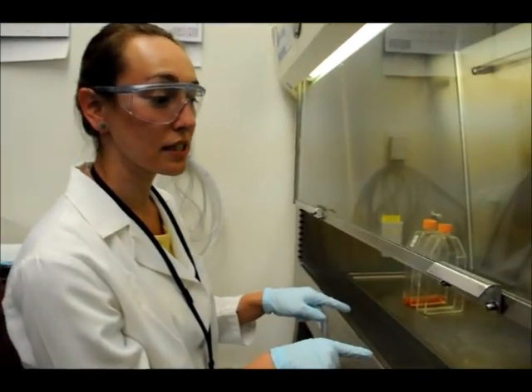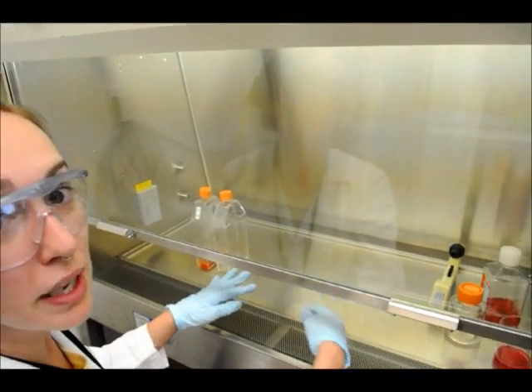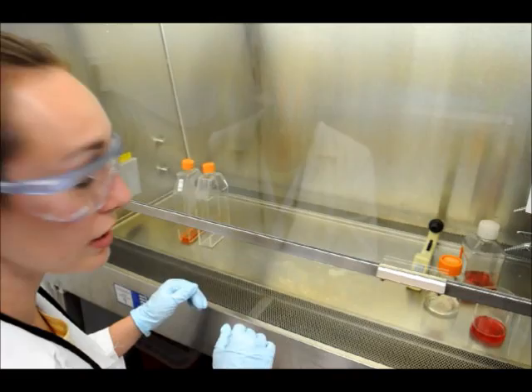So let's get started. I have already sanitized everything inside. Everything is in. Make sure you leave space in the middle for the air supply to work so you don't contaminate anything.